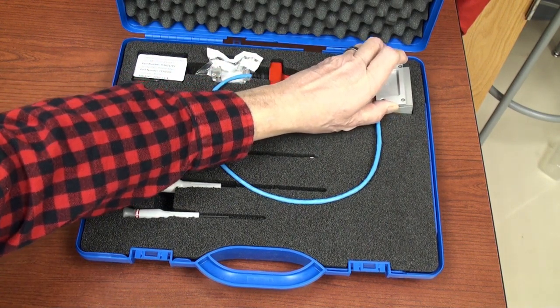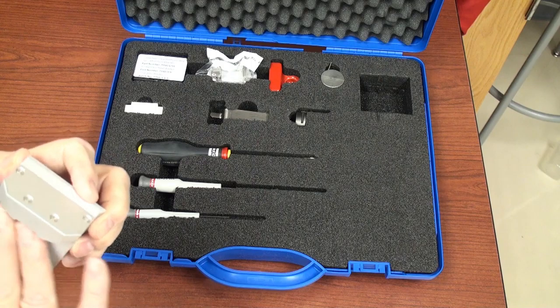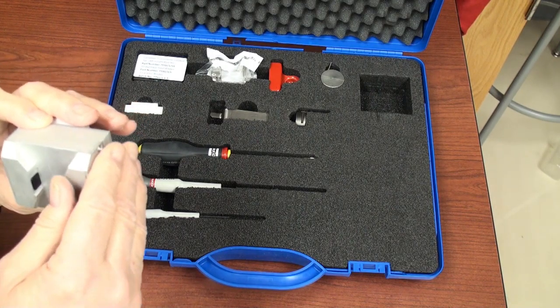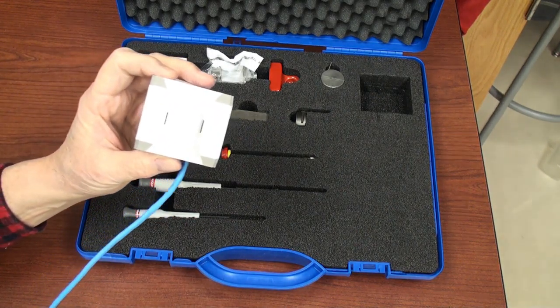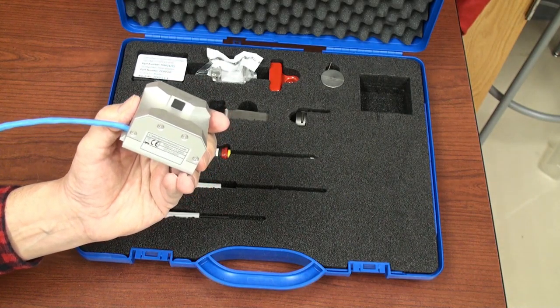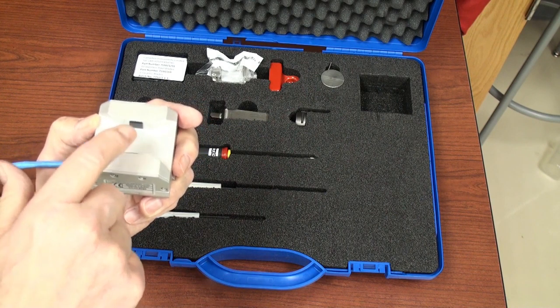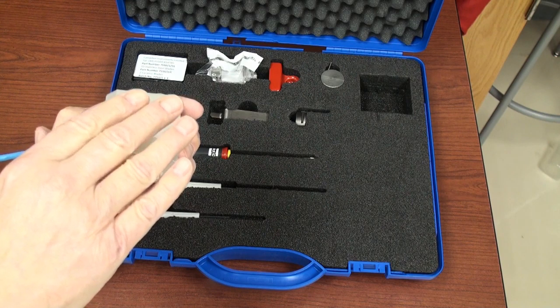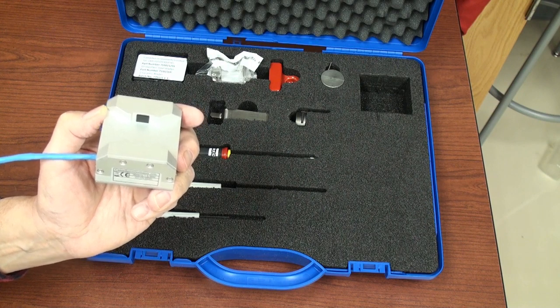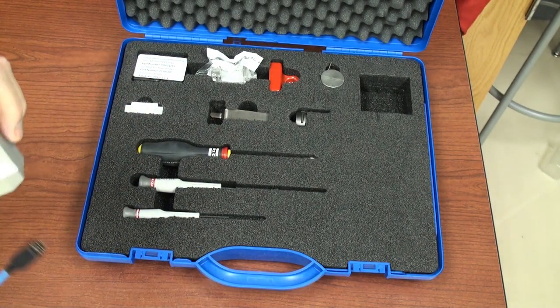The first item I'll take out is the Z-axis calibration system, which we use for calibrating the Z deflection of the blade. The 7000 SMZ2 has a built-in calibration system to minimize the Z deflection of the knife blade to the submicron level, so you have less damage to the live tissue that you're sectioning. We'll investigate this further later on in the video.